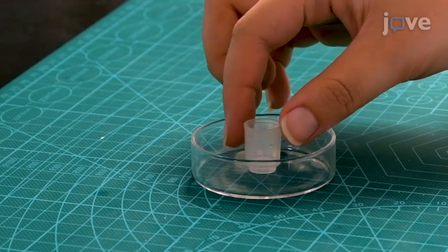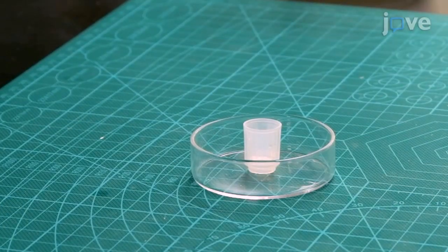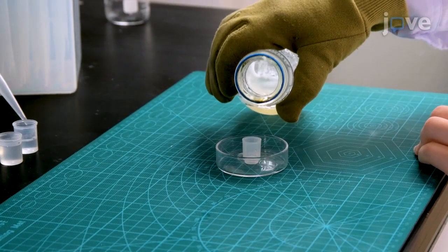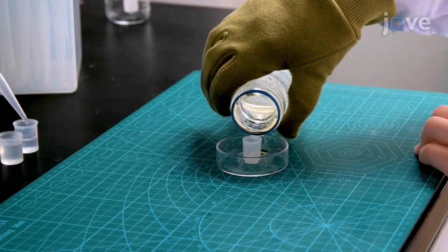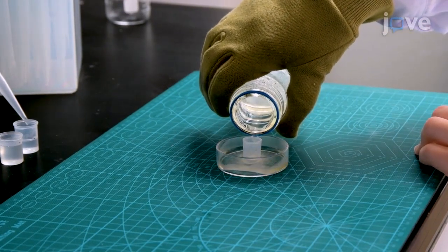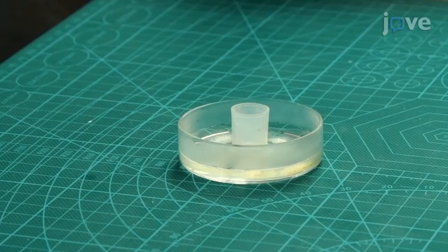If using a pipette tip to make an FBOC, place the cut-off pipette tip section in a 35 mm or 60 mm Petri dish. Pour the 1% agar gel into the Petri dish to a thickness of about 5 mm and wait for the agar to solidify and seal the bottom of the FBOC.